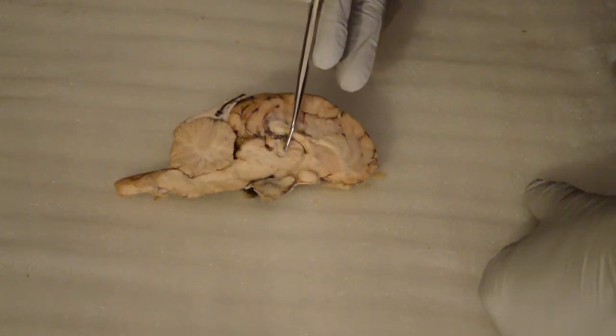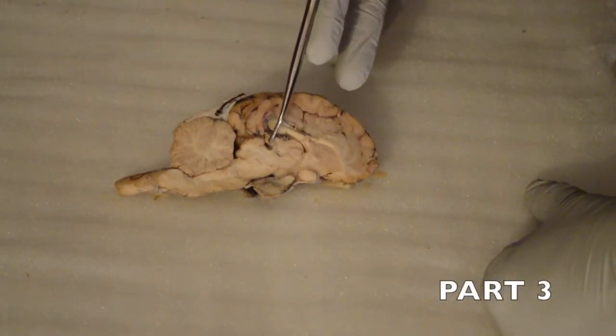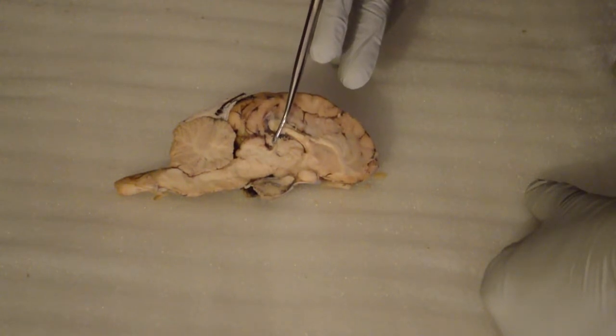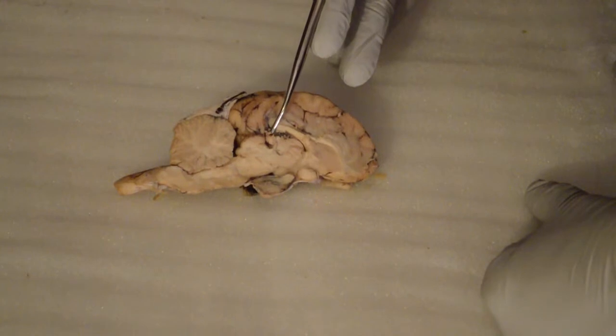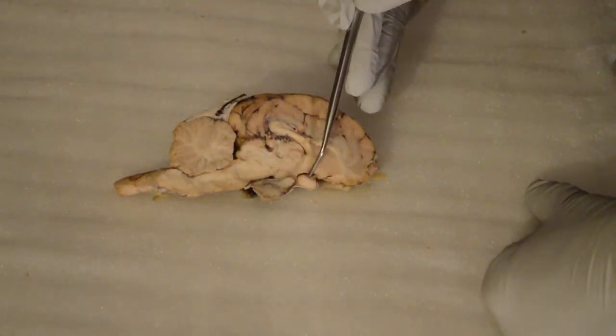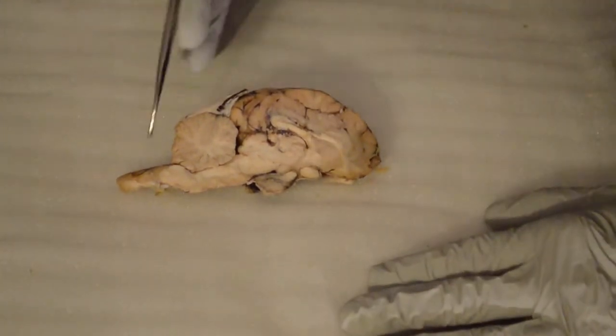Okay. Then we'll go into the cerebral peduncle, which is going to be right here. Okay. That's the cerebral peduncle. Then it goes into the pons. The pons are actually going to be back down here. That's going to be your pons. Then it's the medulla oblongata. The medulla oblongata is very, very key to note here, but it's going to be down here.